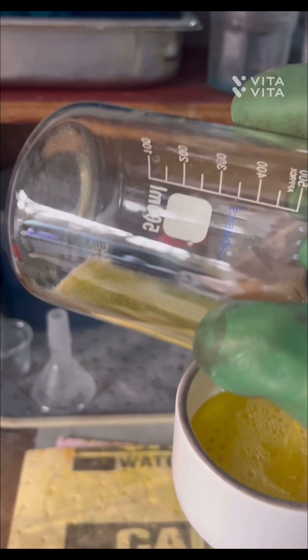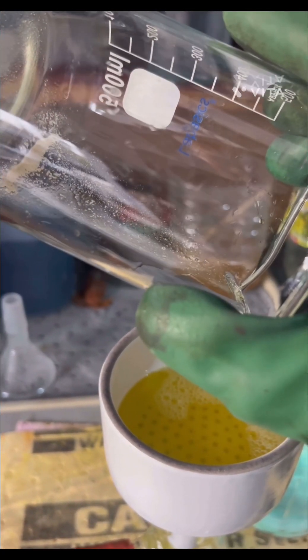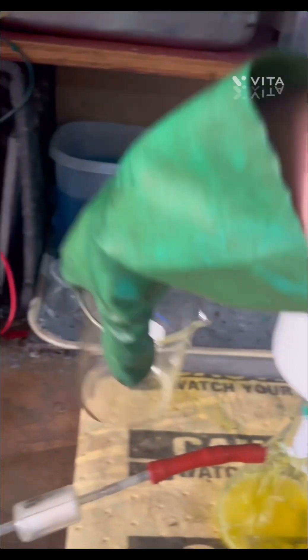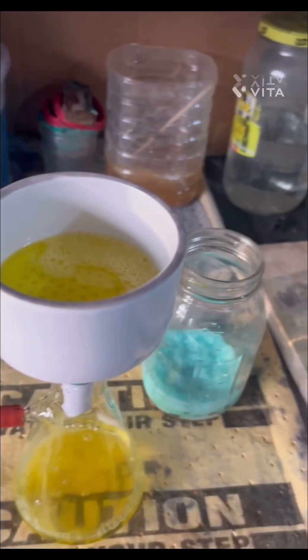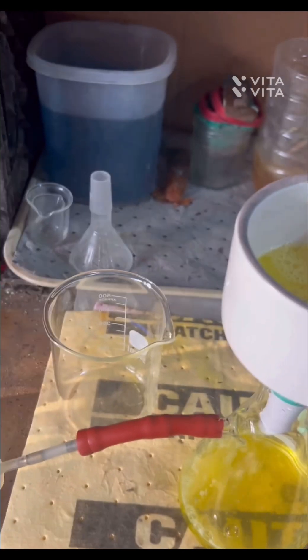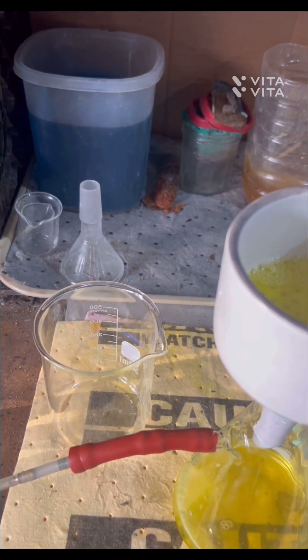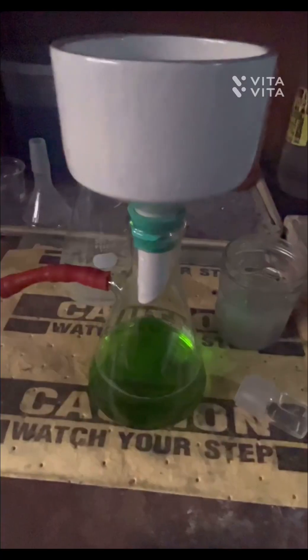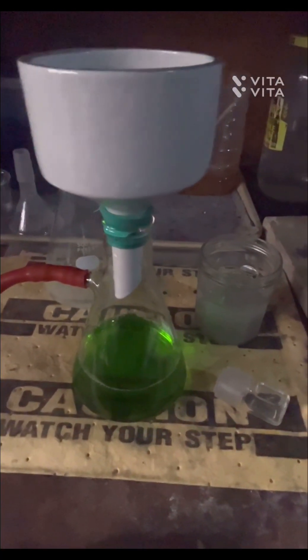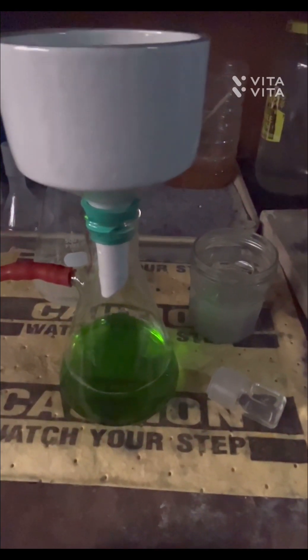You can see a little bit of that chloride right there. I think I'm just going to leave that like that. When I filter it, I'll put it in my container. It's either lead chloride or silver chloride — we'll figure it out with some hot water. Okay, we're filtering out some more stuff to process with iron sulfate and we'll get back to it.